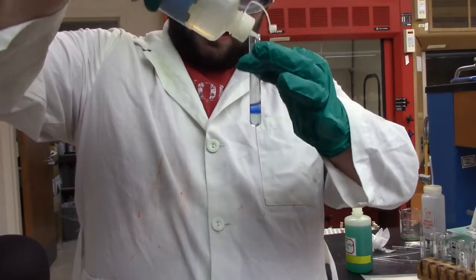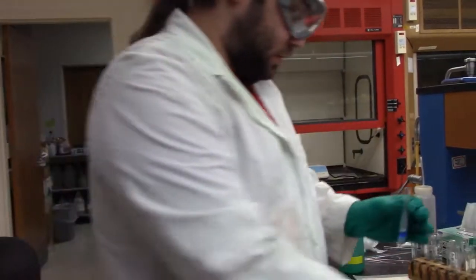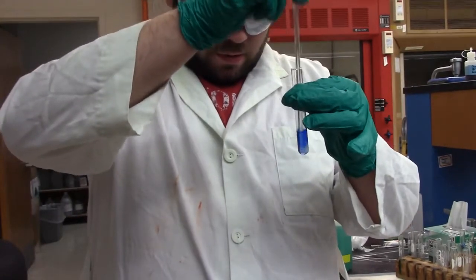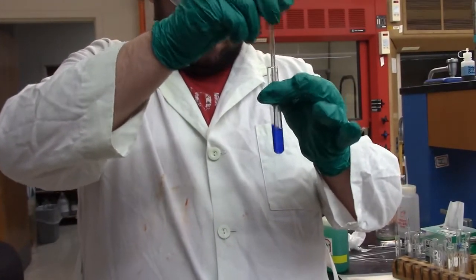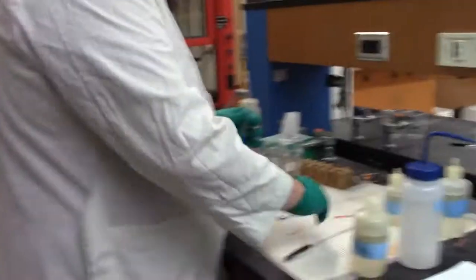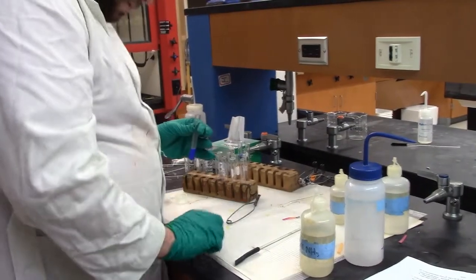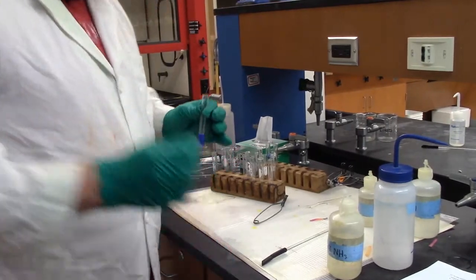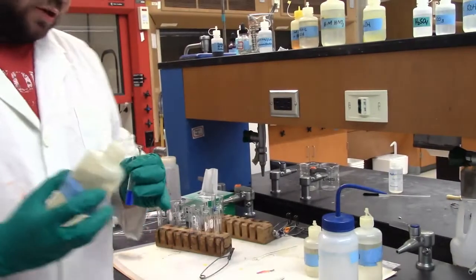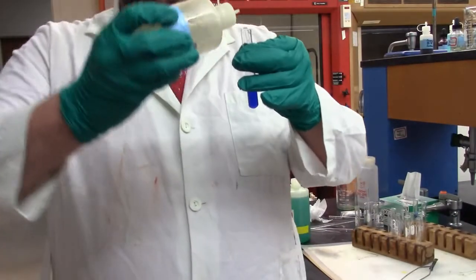And there is an even darker blue solution that's forming when I add that. And I'll mix it all together. And that smells like pure sulfur. Oof. Can't pick it up. And now we're basic, and we're going to add 10 more drops of this just to be extra certain.